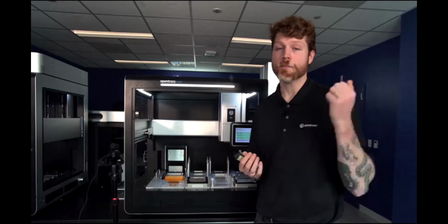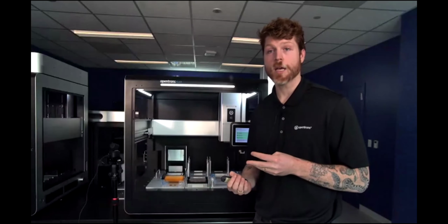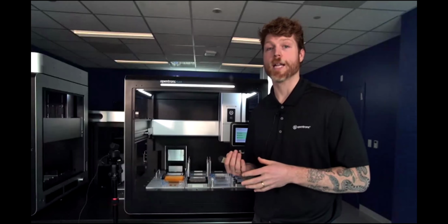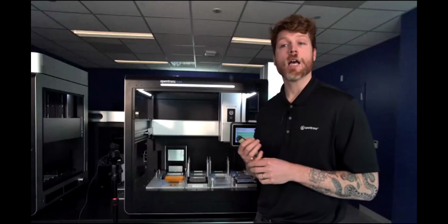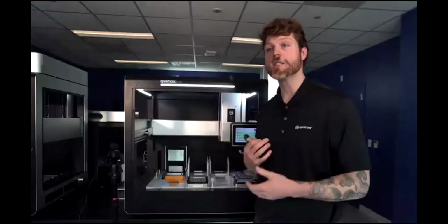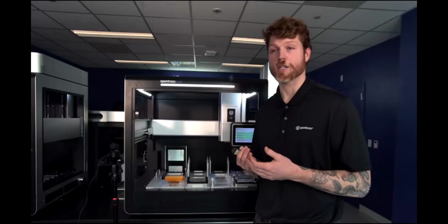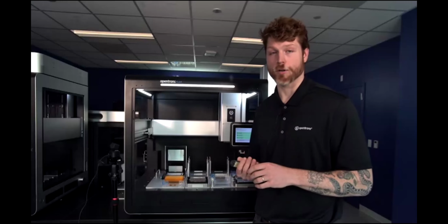You can use this pipette, as Matt had mentioned, for single tip and single column pickup. So you can support all the different needs of this protocol with one pipette. There's really no need to have multiple pipette types to fulfill all of your protocol needs. As Matt had mentioned, he's using different reservoirs or tubes for his reagents. And so having the ability to utilize this partial tip configuration element of the 96 channel is incredibly important for their protocol.